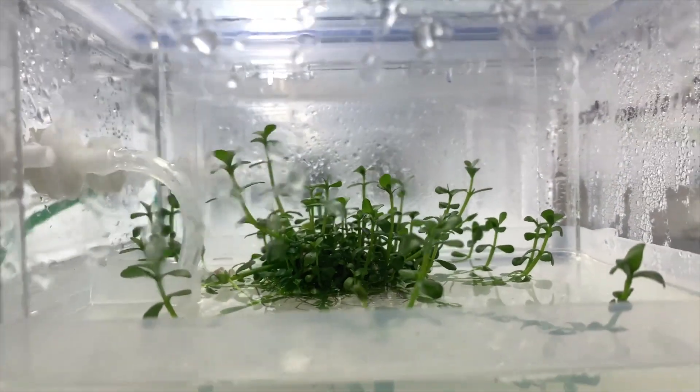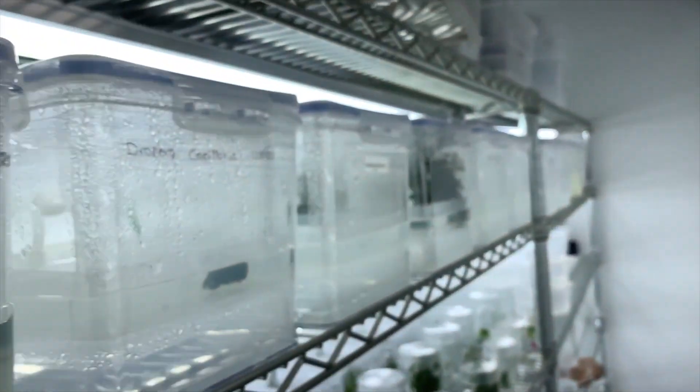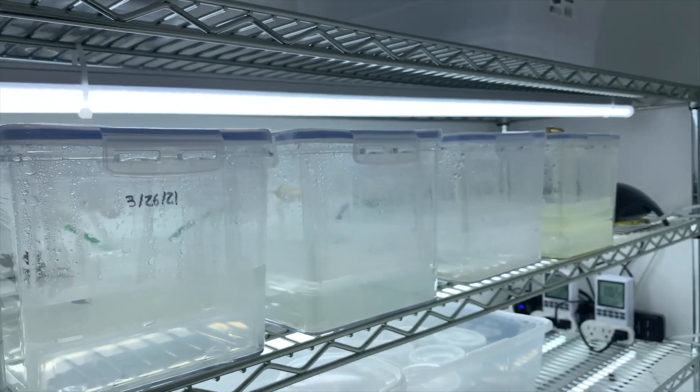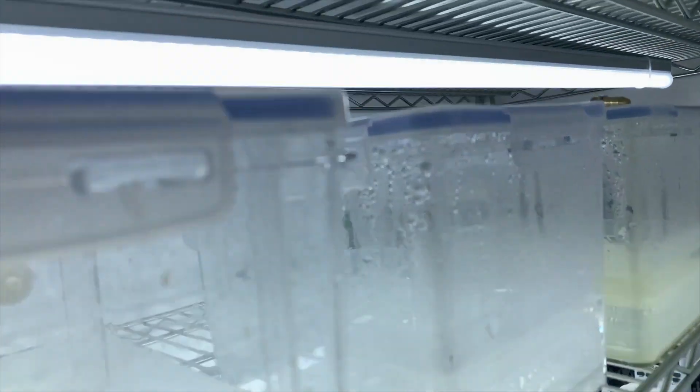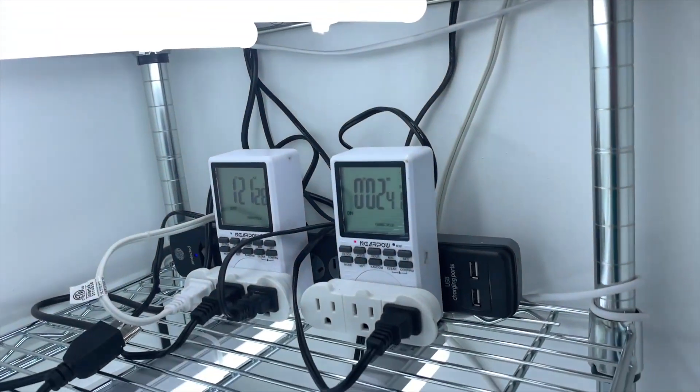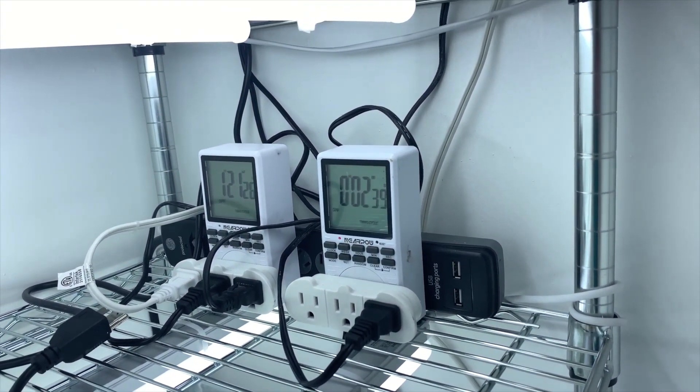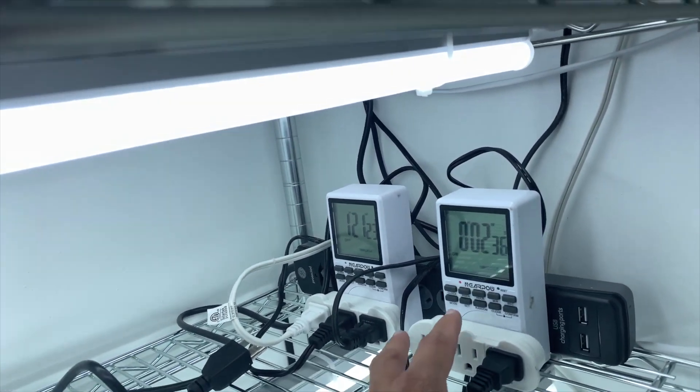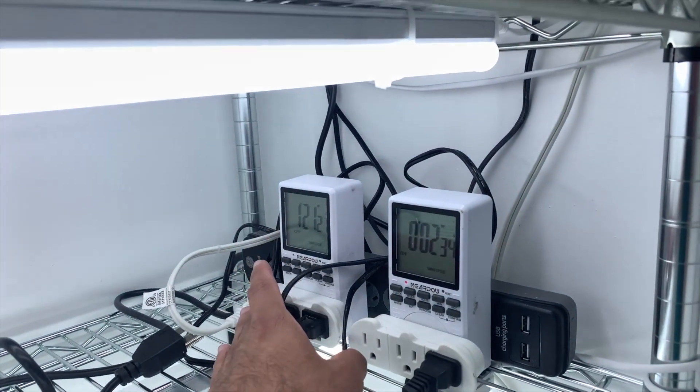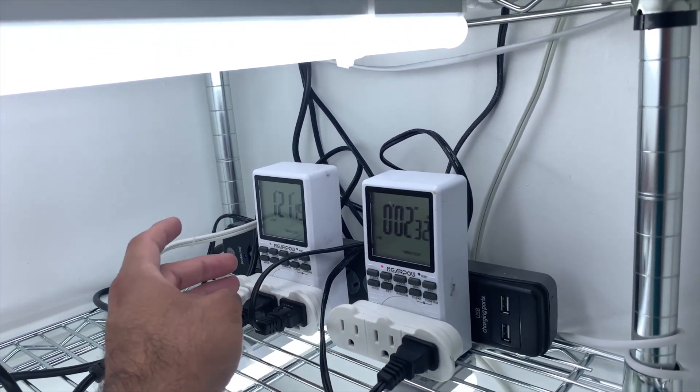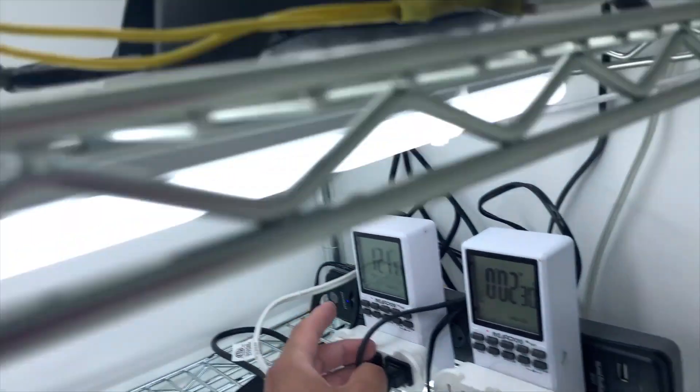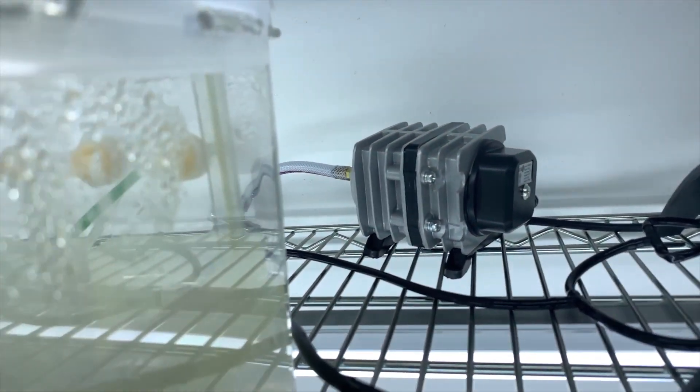What's going to happen, and I want to pause the video here in a moment so you can just see what is going on, this is for five minutes. And after the five minutes what is going to happen is that this pump is going to turn off and this is going to turn on. Now this setup uses three filters.